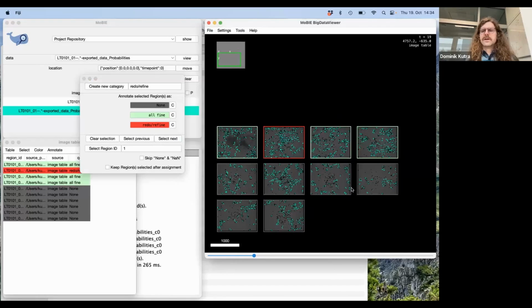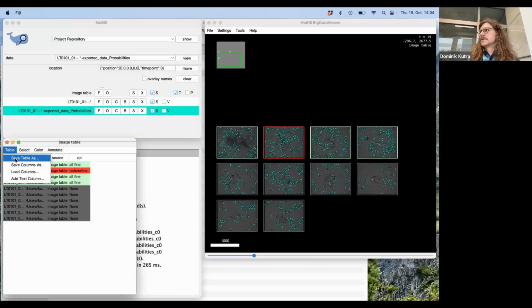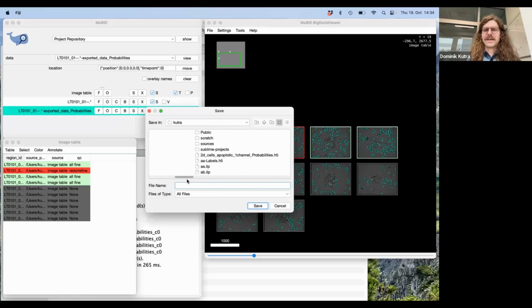But also, what then the ultimate goal would be is you go here to table, and then you can save this table as a file that you can then, I don't know, look at in Excel or share with your collaborators, or make a graph like how many data sets were good and how many were bad. Let's see. Okay.